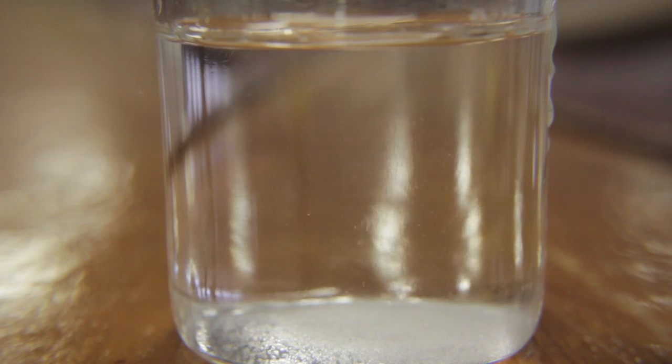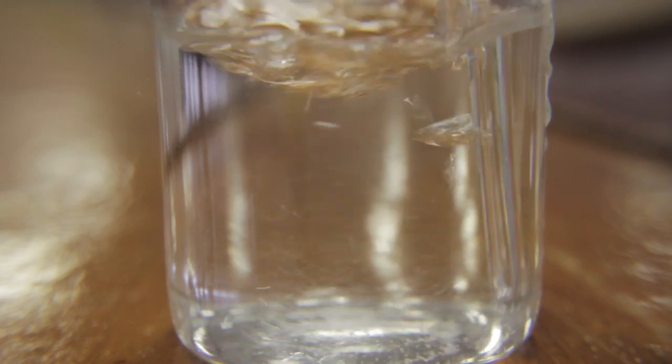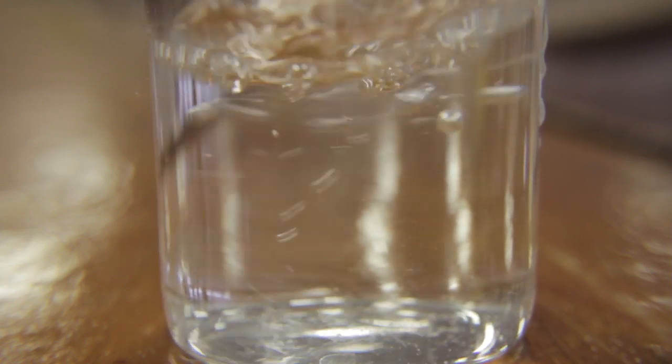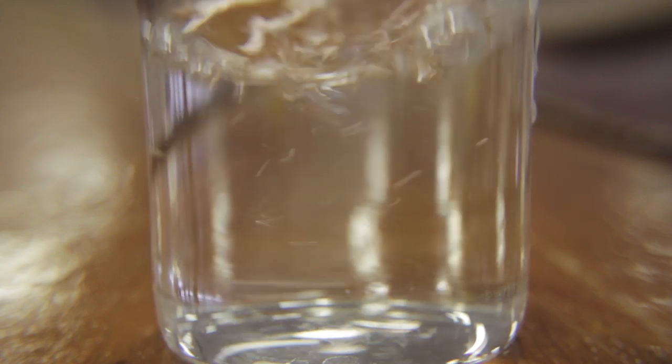As you can see in this demonstration, the salt disappears in water. What actually happens is that the ions in the water attract the ions in the salt and pull them out of the crystal lattice structure, giving the illusion that the salt has disappeared.